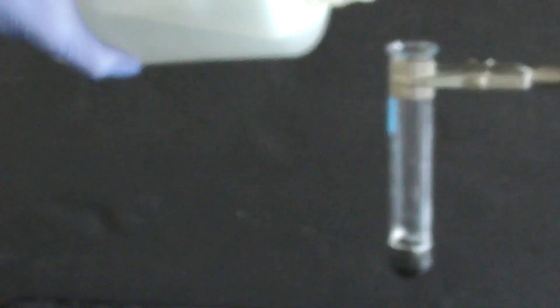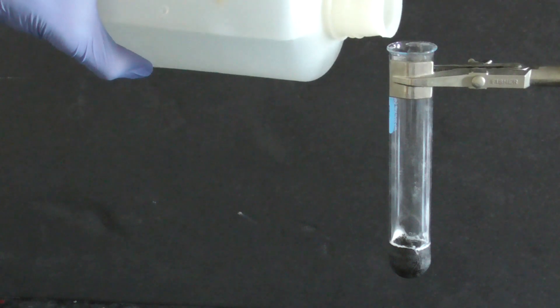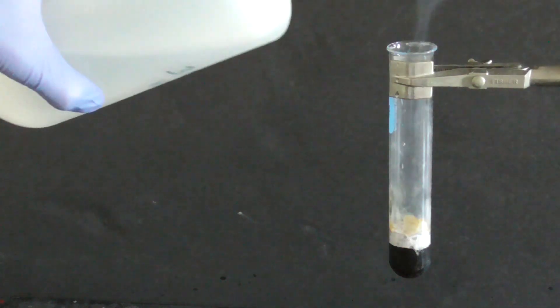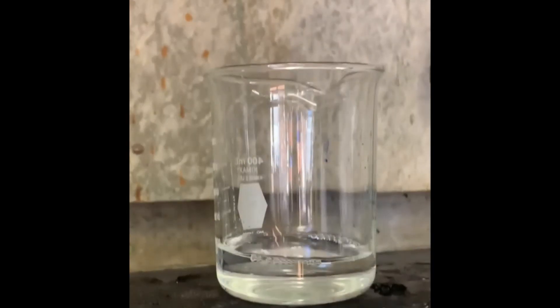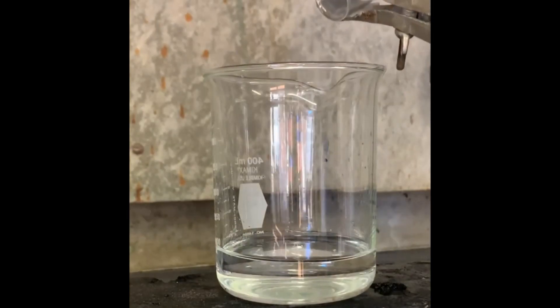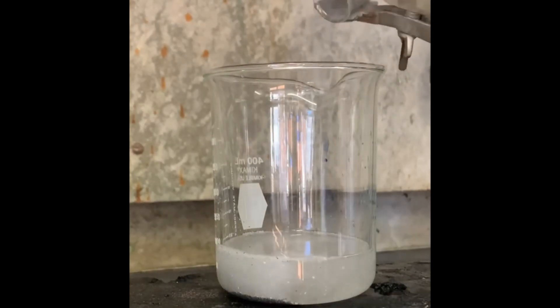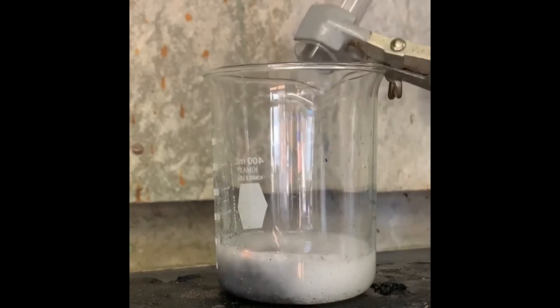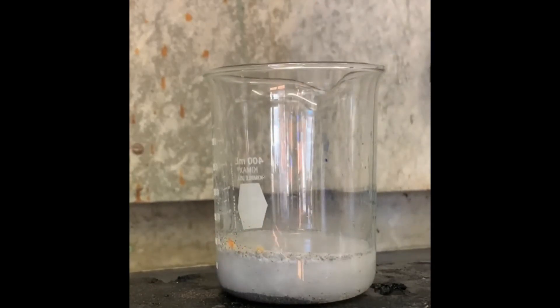Watch what happens when we pour some acid onto the mixture of products. Oh, that's cool! We see a bunch of tiny little explosions. In this case, I'll add some acid to this beaker and then pour the product into the acid. Yep, once again we get the tiny sparking explosions.